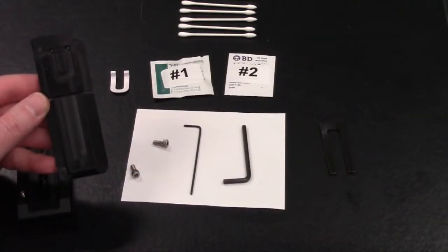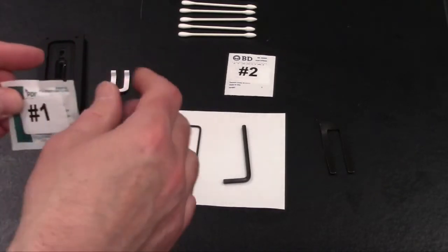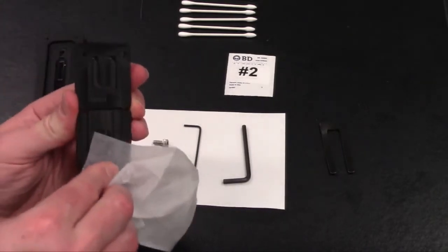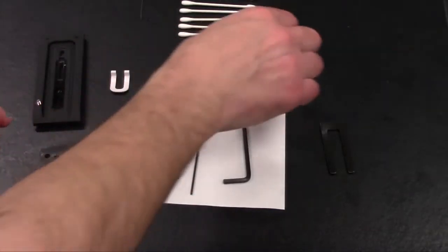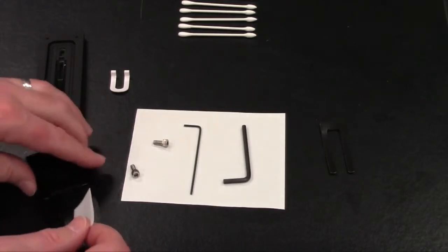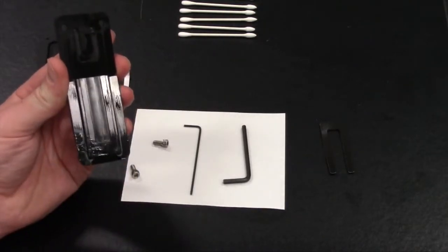Okay, so to clean this, all what we recommend is to take the first towelette, which is the soap again, and use this to clean the area around the lid itself, and you can use this to clean in between and around the spacer to make sure there's no milk or debris present. What you can do is then also use the alcohol wipe as a secondary tool to help clean and remove any of that same residue. So a combination of the alcohol and the soap will help remove any type of milk proteins or anything that is caked on or contaminating the top lid.